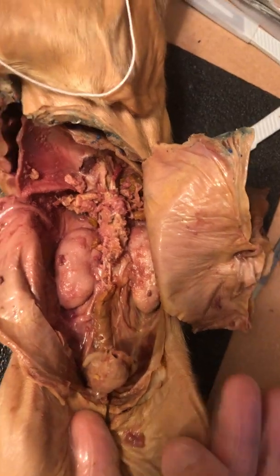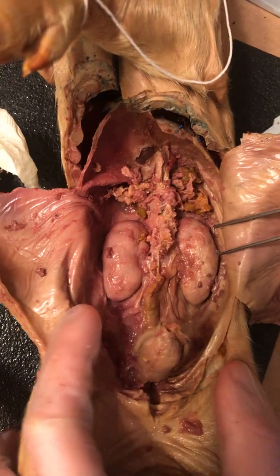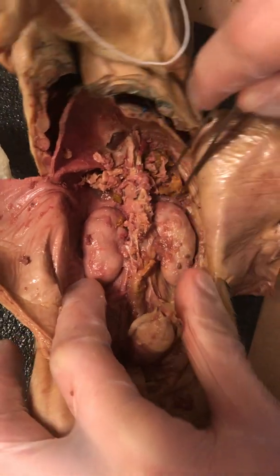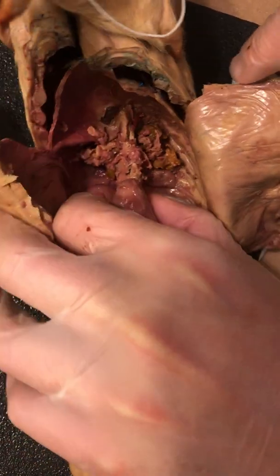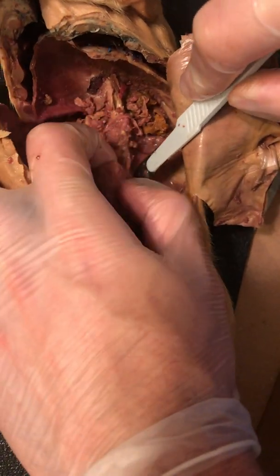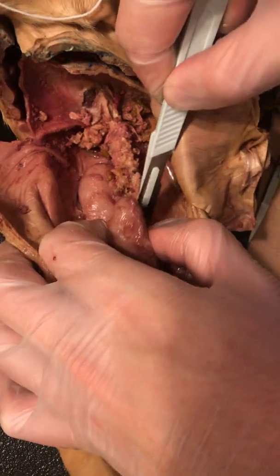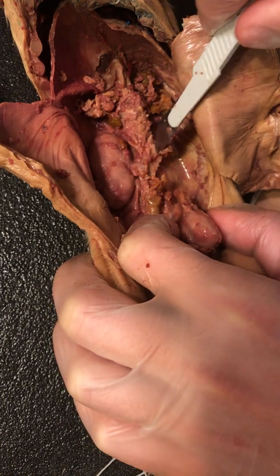Okay. And last but not least, after seeing all the structures here, such as all of the ureters, there's various other structures such as the larger blood vessels aligning in the midline with the pig's anatomy, specifically the aorta and any other vessel like your inferior vena cava.